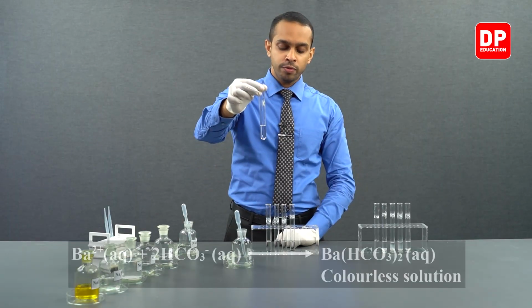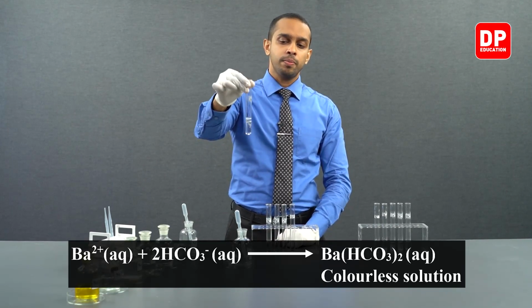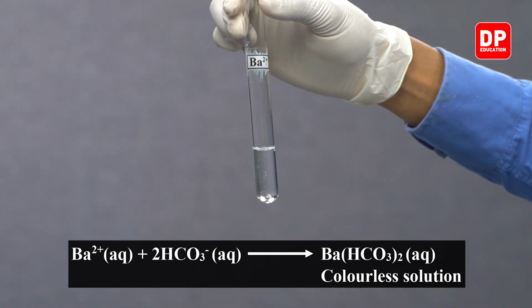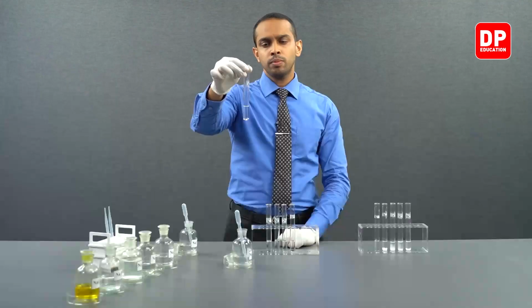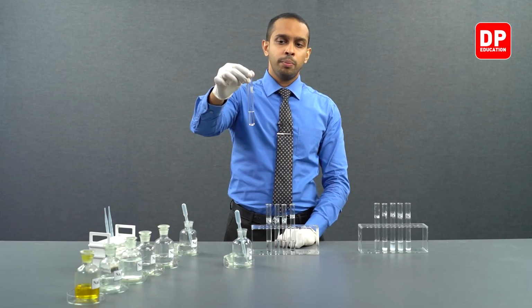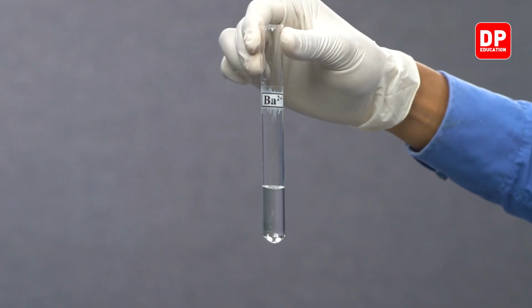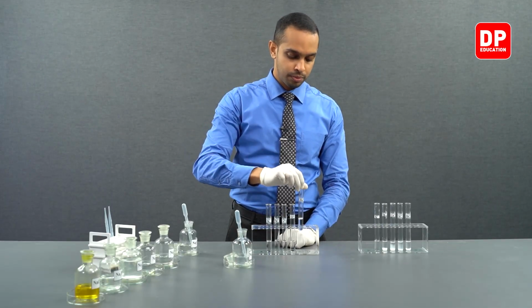I added a few drops of sodium bicarbonate to barium 2 plus aqueous ion solution, and now I'm mixing it. You can see we did not form a precipitate. Barium 2 plus ions form barium bicarbonate with the bicarbonate anion. Barium bicarbonate is a water soluble salt. So therefore, you will not see the formation of a precipitate.